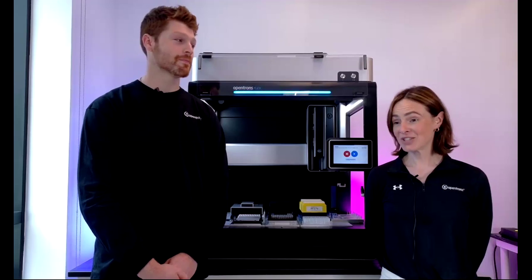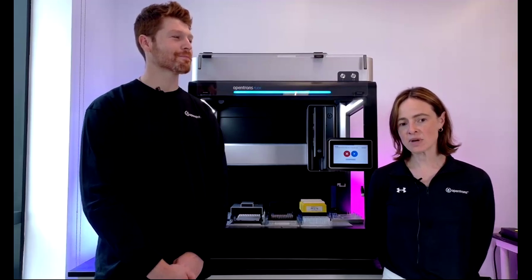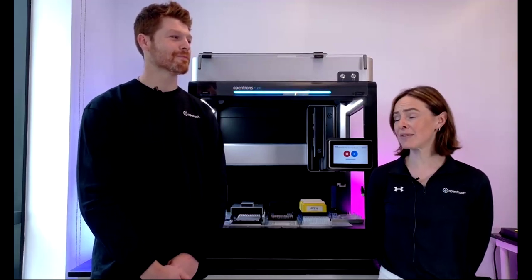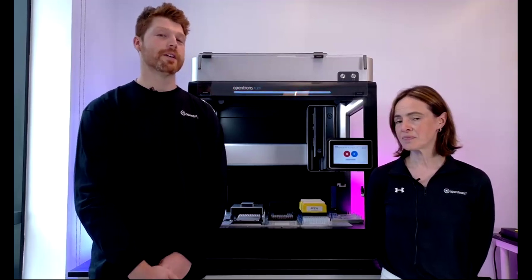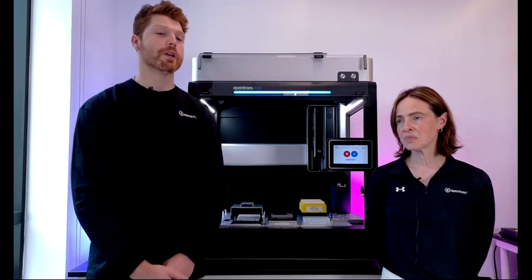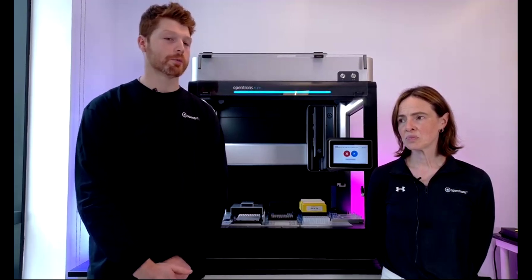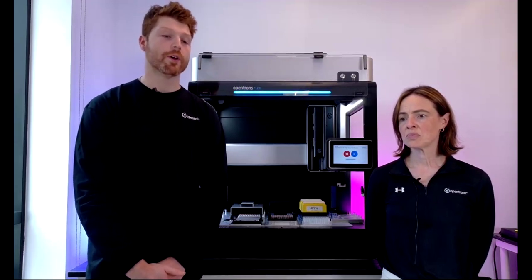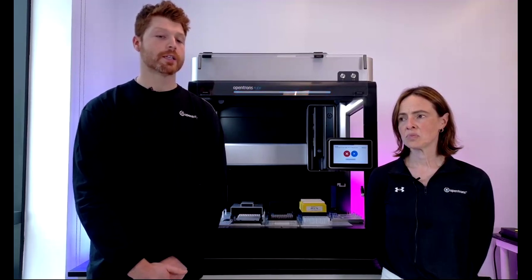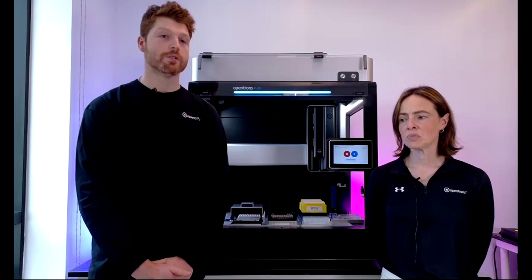That is a great question. I do not think we have tried to do that. We could have a go at it, but we haven't tried it. If the necessary steps are that we pipette very accurately to set locations within those wells, I think we would probably need some troubleshooting and optimization around what those aspiration and dispense heights look like. But we should totally have the capacity to do that on the Flex.